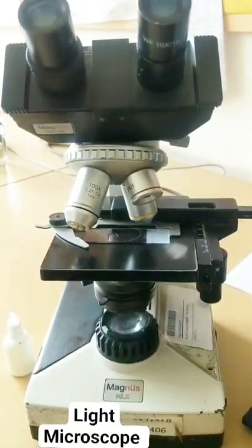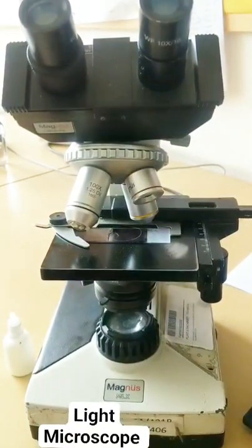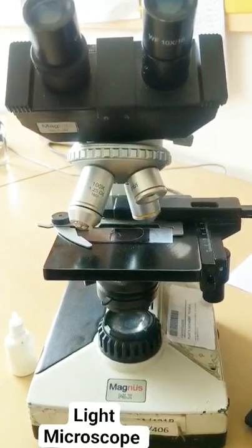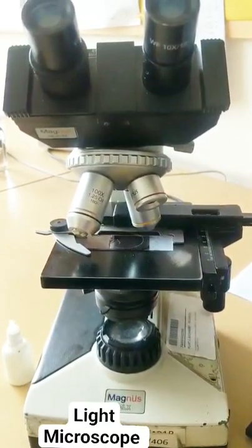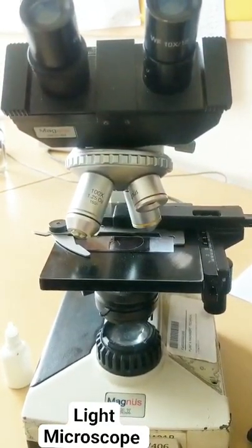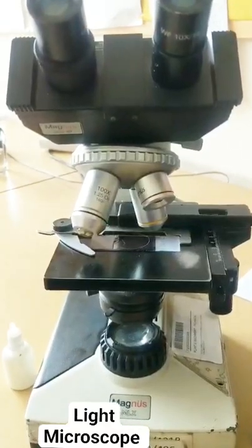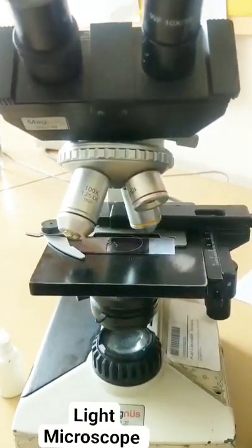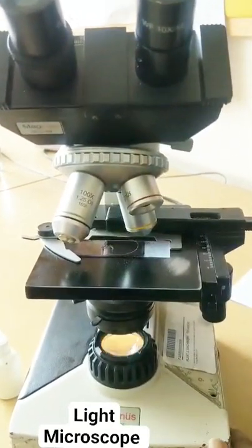Hi everyone, so today let's quickly have a discussion on the parts of a microscope. Let's finish this small topic. So this is a light microscope that we've got, and the first thing I want to show you is the light source.